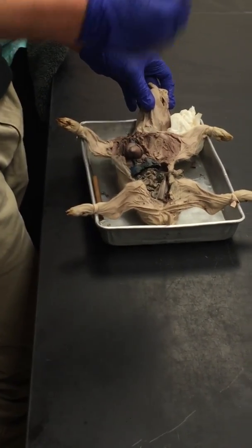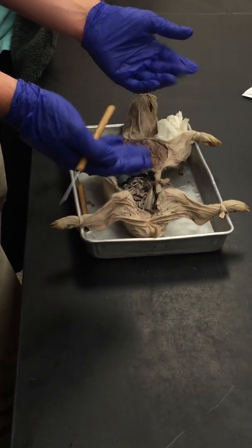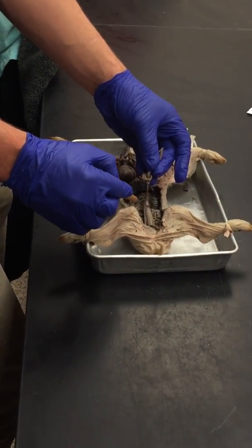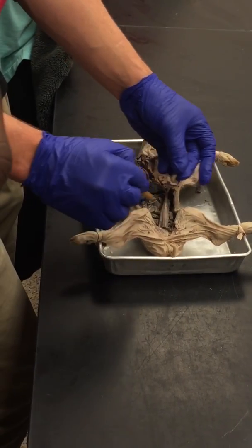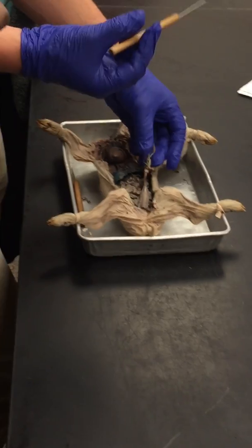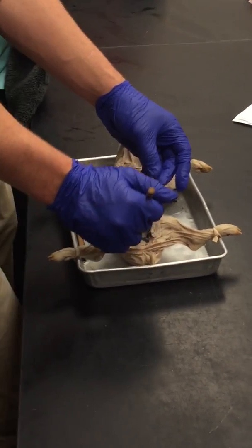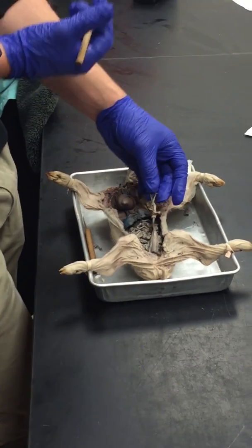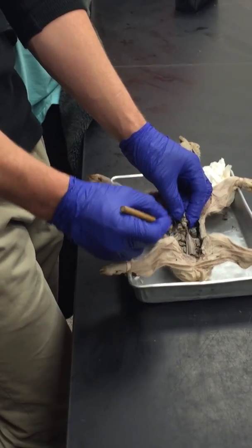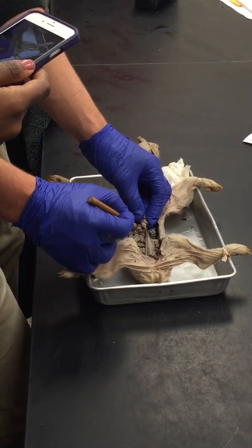Once the blood is in the aorta, it will just distribute itself through the rest of the body like it would regularly. And then whenever it has all the waste and deoxygenated blood, it will go through these two right here. These are the umbilical arteries. Like I said, it's opposite in the fetal circulation, so this is where the deoxygenated blood will go through the umbilical arteries back to the umbilical cord for the mom to then take it out as waste. And then just one more thing, between the umbilical arteries here, that's the urinary bladder.